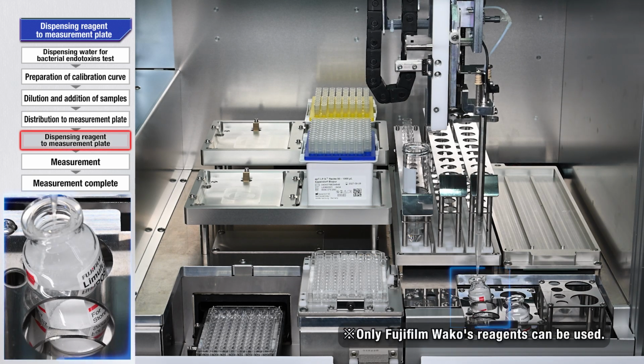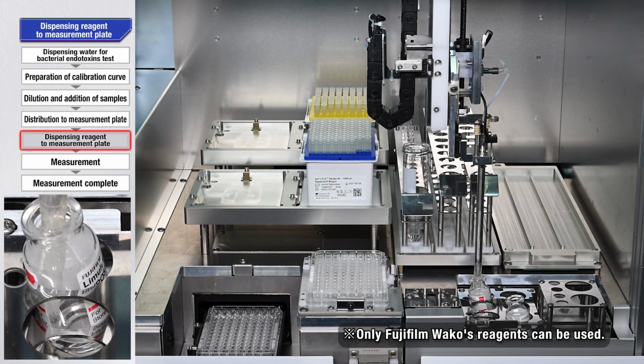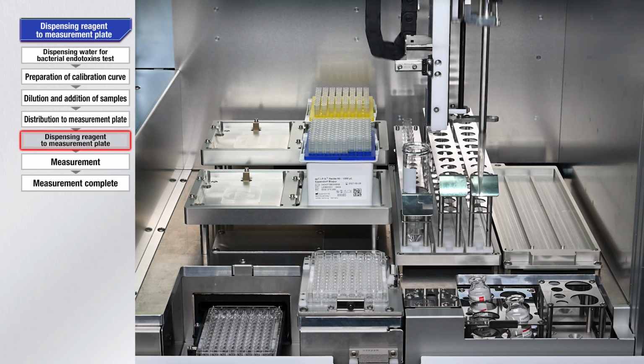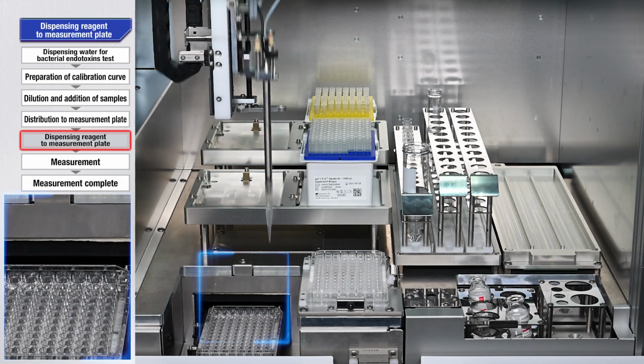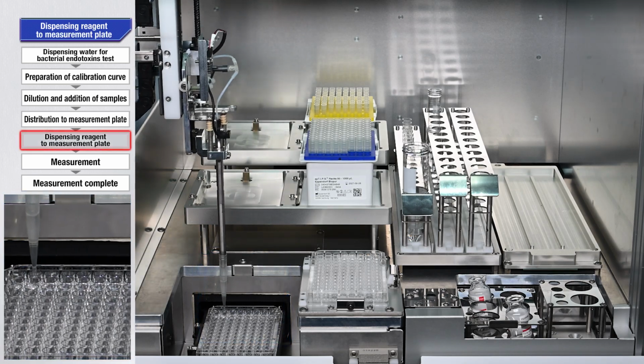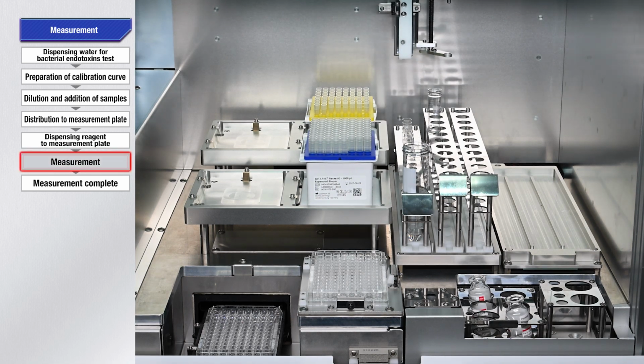The lysate reagent is dissolved. After dissolution, it is repeatedly added to each sample. Finally, the plate is stirred and measurement begins.